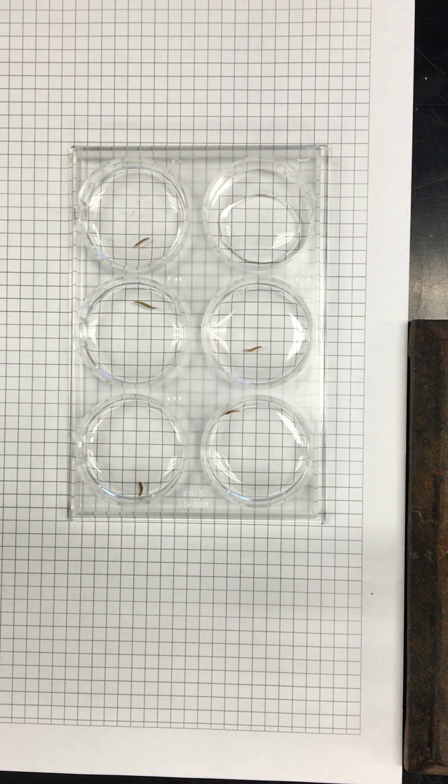So we don't think they're also dirty. I realize that if you don't have the top line, we don't have the label, so I'm fixing that. Plus, the weird reflections might be hard to see. Are we going to put the labels underneath? That's what I'm doing. Should we throw the H2O ones on that? Yeah, I was just going to do it at the very end of the video. 980 microliters of water we add to the wells and the antagonist. Got it.